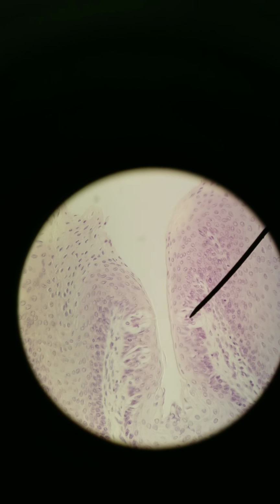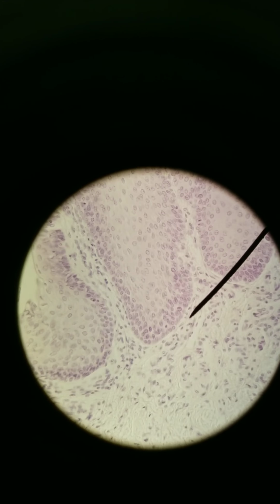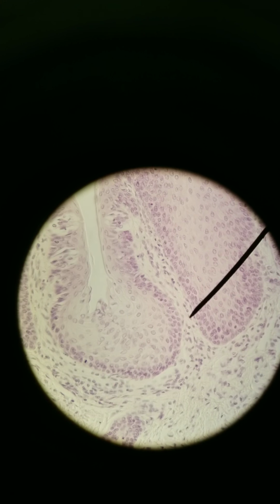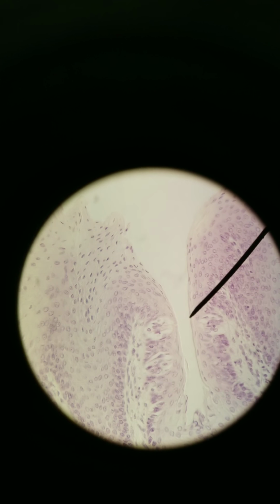Taste buds are special receptor cells, just like what we saw with the photoreceptors and what we're going to see with the hair cells in the cochlea and in the vestibular complex. These are special receptor cells that then communicate with sensory neurons. All right, so this is what you'll need to identify with the tongue histology, identifying taste cells, the gustatory cells. Gustatory is your sense of taste.